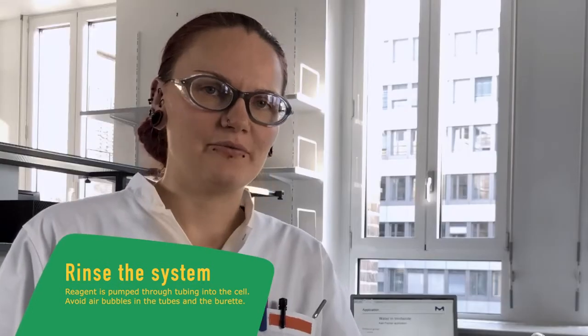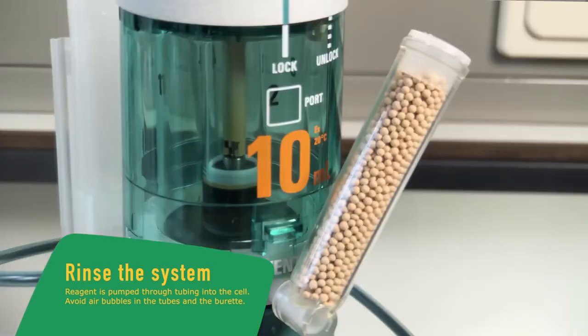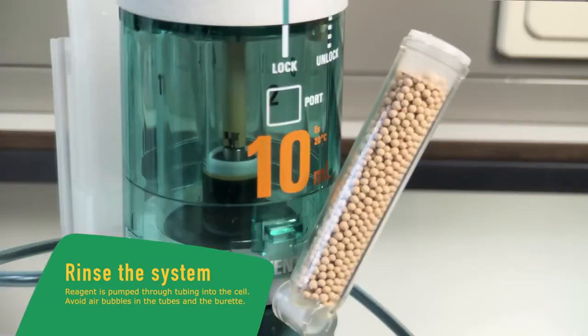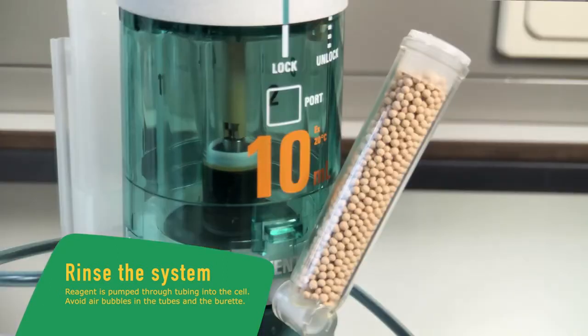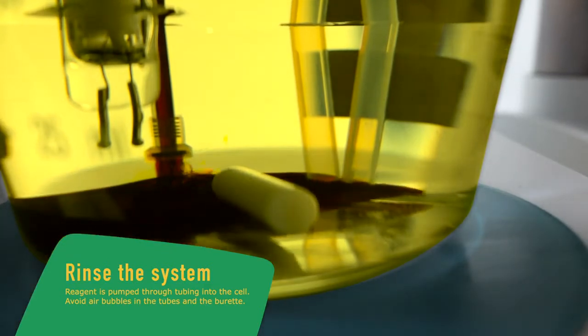And now we will see the new reagent pumping through the tubes into the burette and then pumping into the cell.